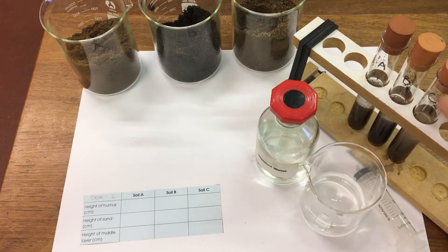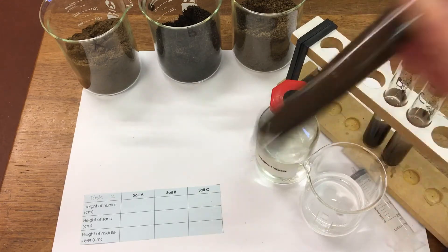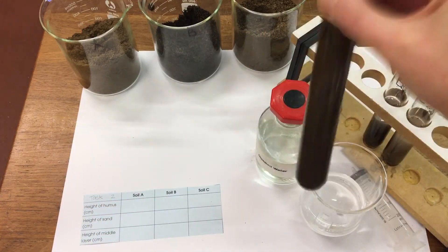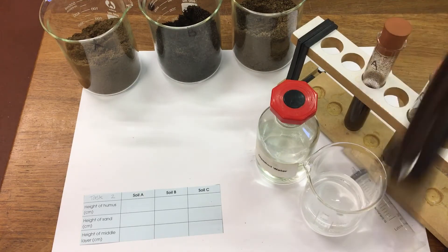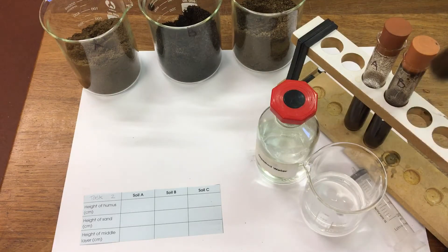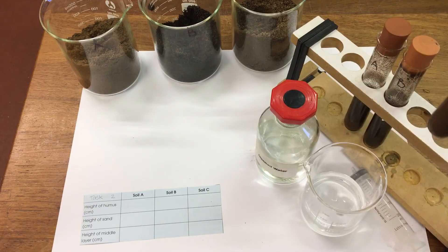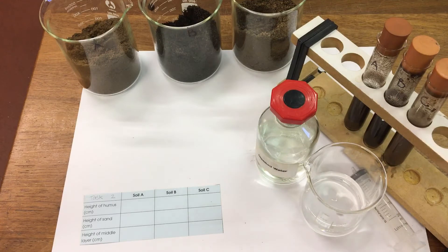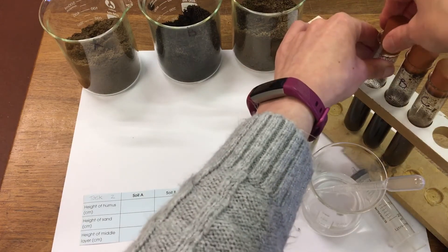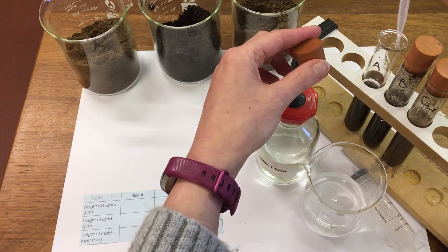I'm then going to give our boiling tubes a really good shake to make sure the soil and the water are mixed. I'm then going to use a pipette and just take some additional water and just push down any debris around the tube so it's easier to measure.